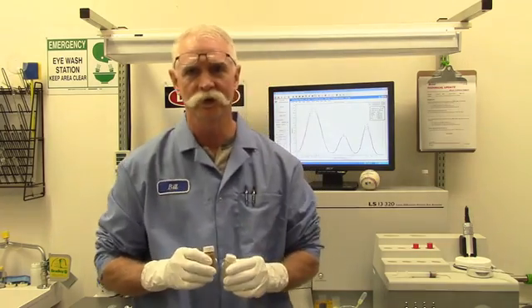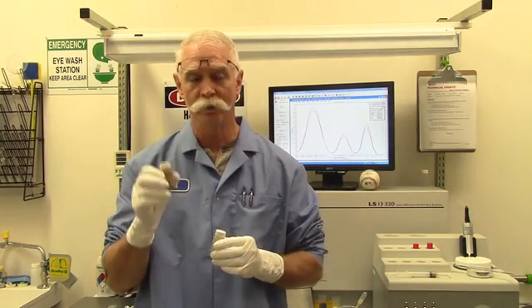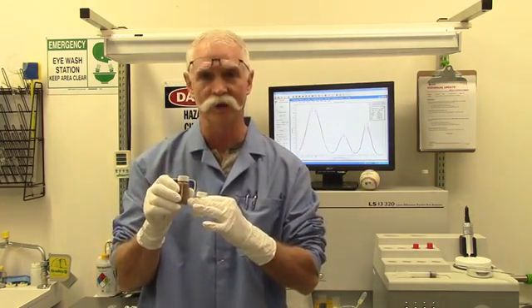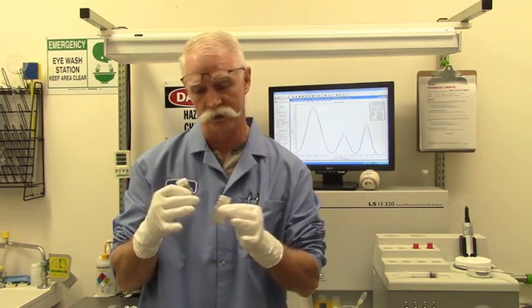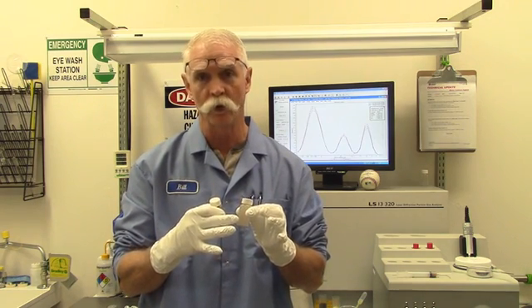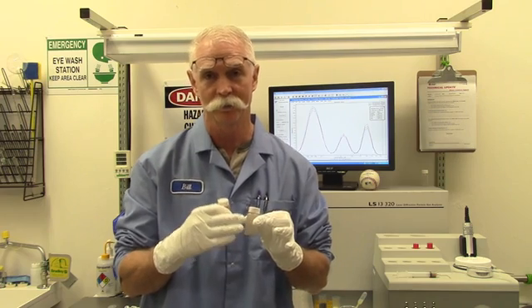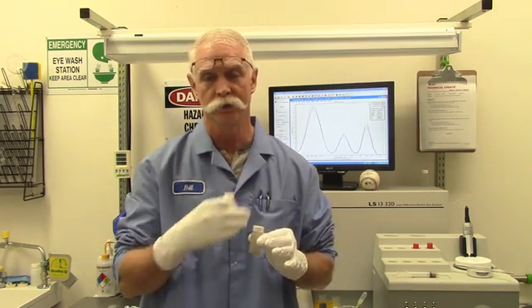Before running some types of materials, you may need to perform a mixing outside, and then because of the heavy concentration, you may actually be required to perform a dilution to get the material concentration down low enough so when you introduce it to the machine, you're not already concentrated. So that may be a two-part sample prep for you.